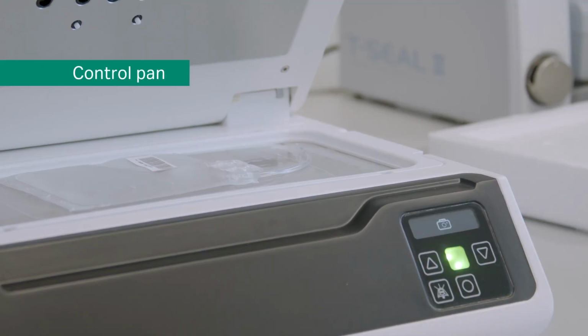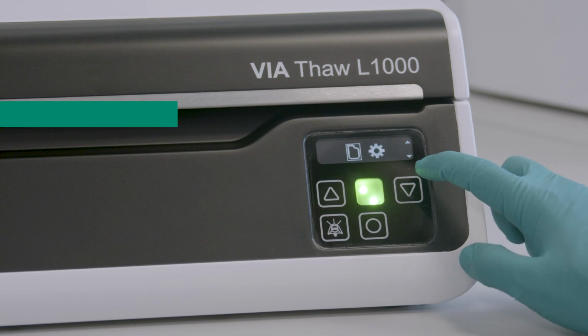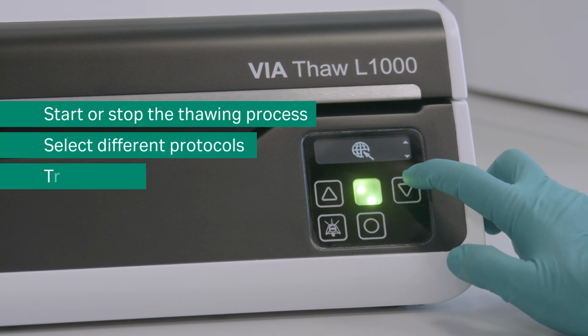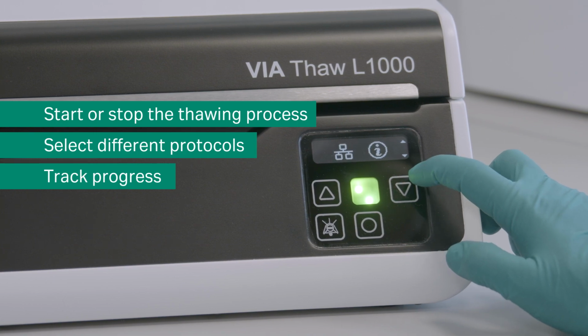At the front of the instrument, you will find the control panel. From here, you can start or stop the thawing process, select different protocols, and track thawing progress.